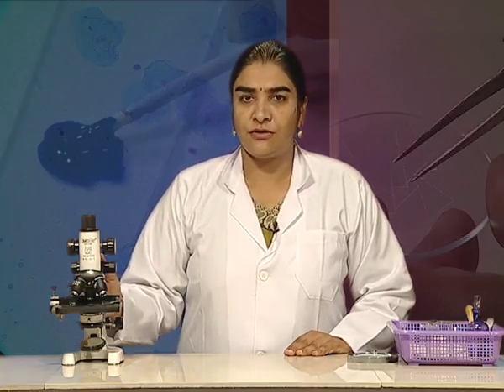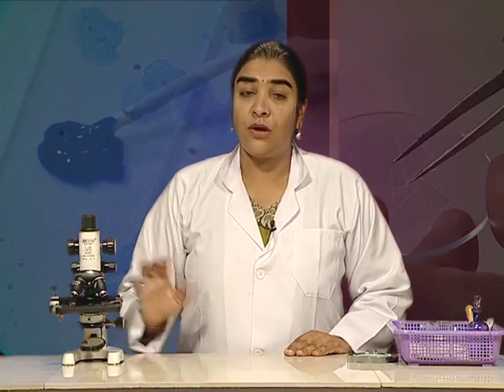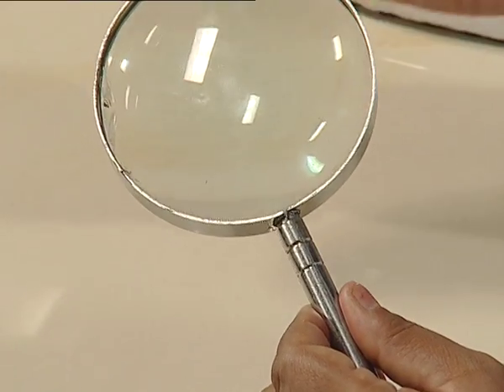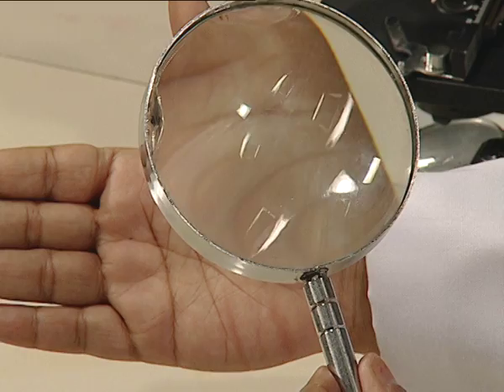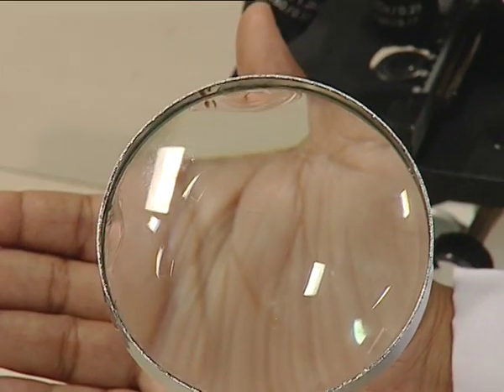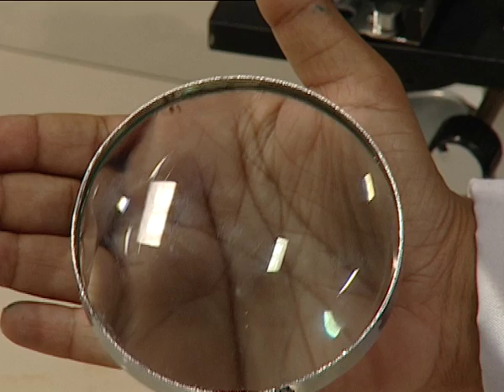How are we able to magnify and observe the cell structure? For this, we use a compound microscope. Would you like to know how a compound microscope works? All of you must have used a magnifying glass at one time or another. When you try to see something through a magnifying glass, it appears bigger in size. The same thing happens when we try to see the cell under a compound microscope. So today, we are going to learn the process for making a temporary mount of cheek epithelium and observe the cell structure of cheek epithelium.